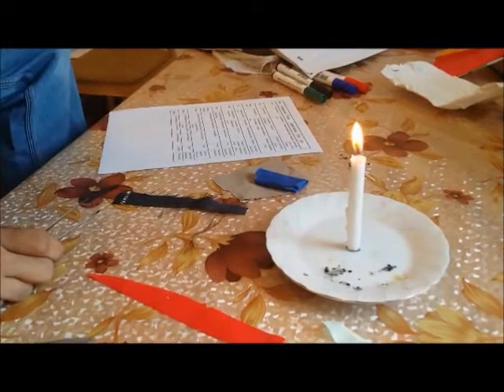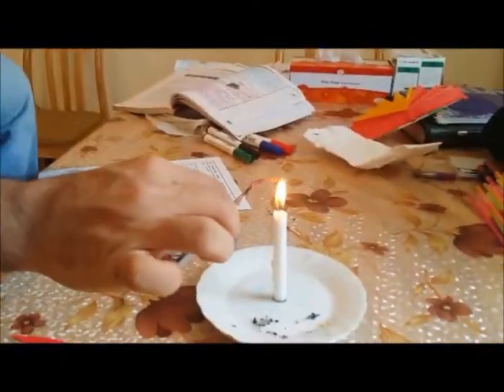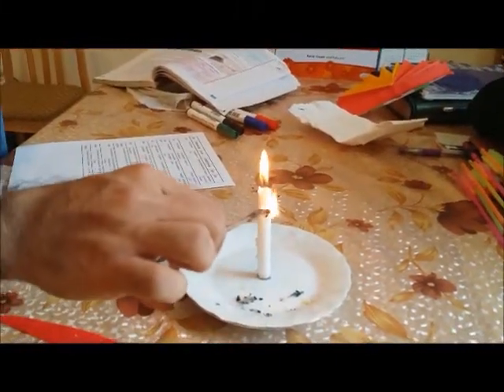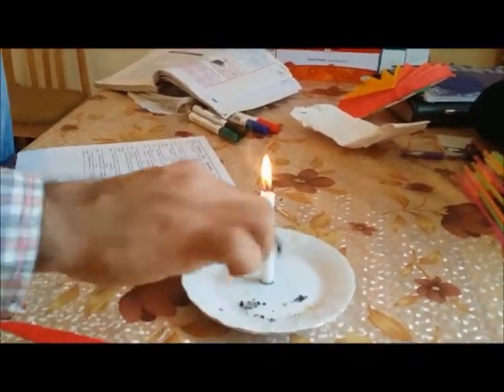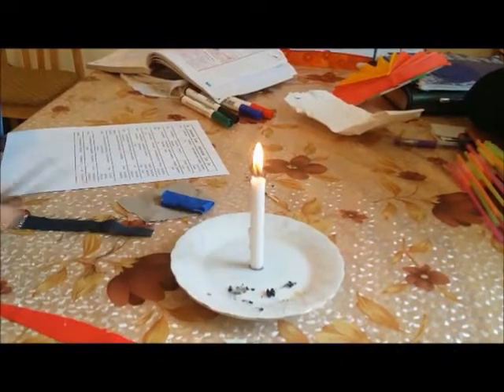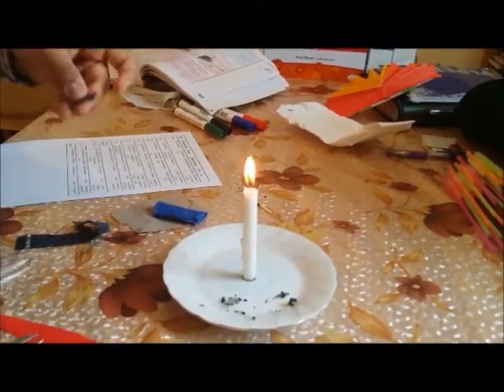We can't conclude it now, so let's see what we can do while burning it in the flame. It burns very slowly with a flickering type — can you see this flickering effect? This is called the flickering effect. It burns with a flickering flame, sizzles and curls. When removed from the fire, it stops burning.